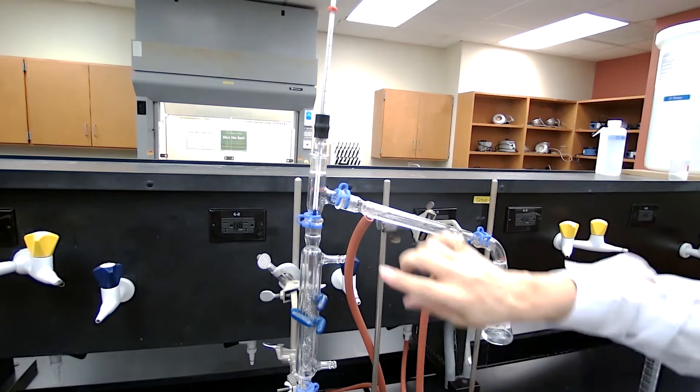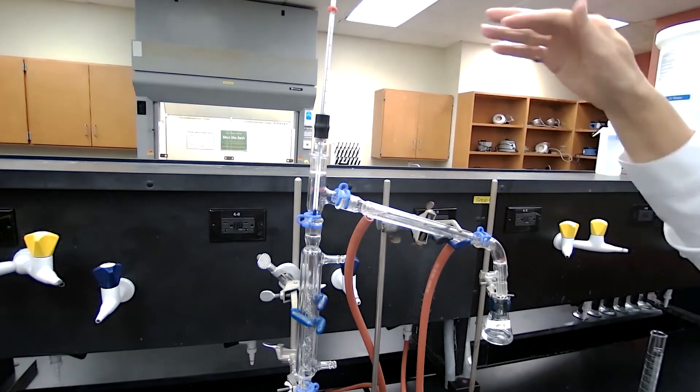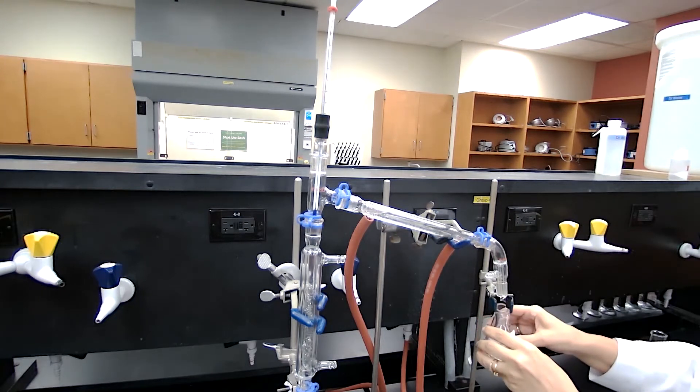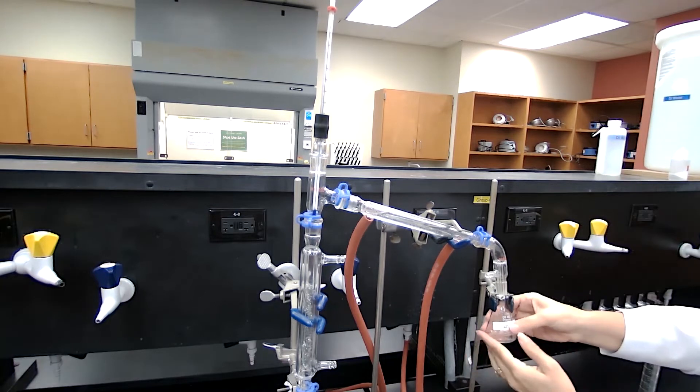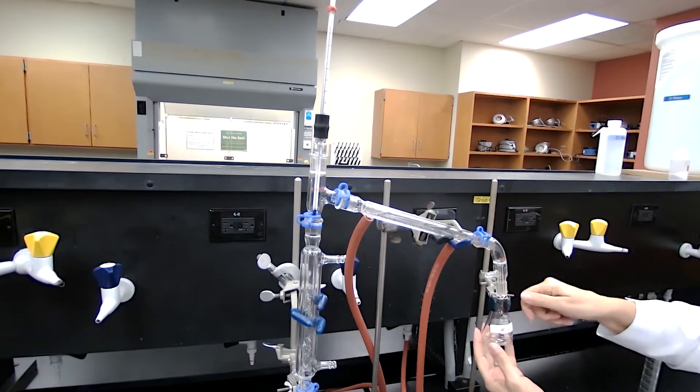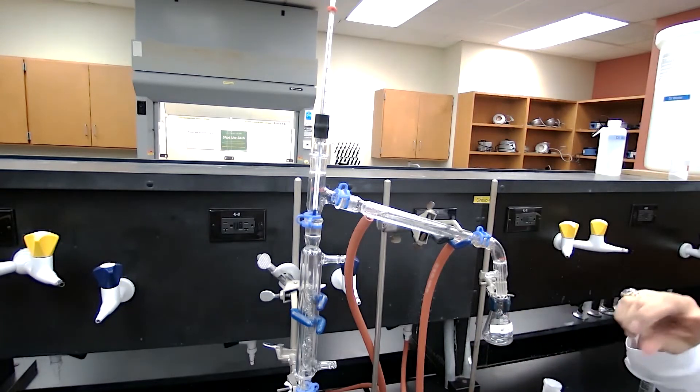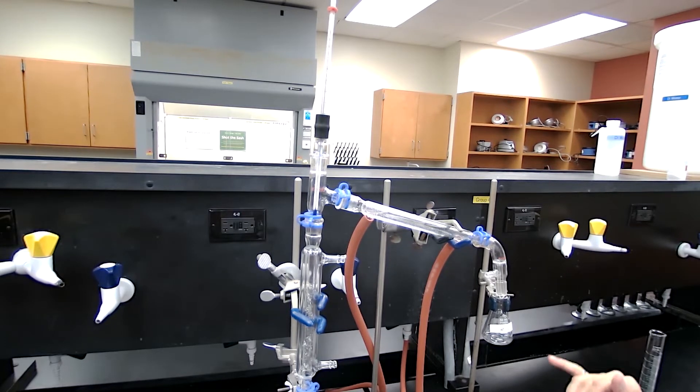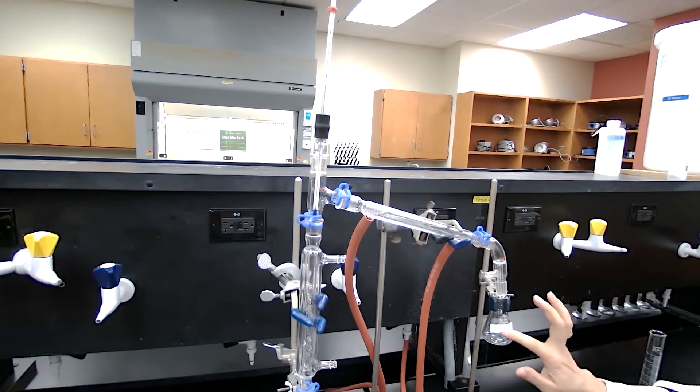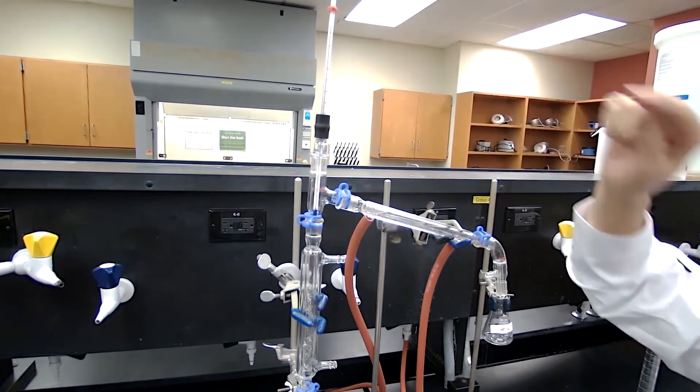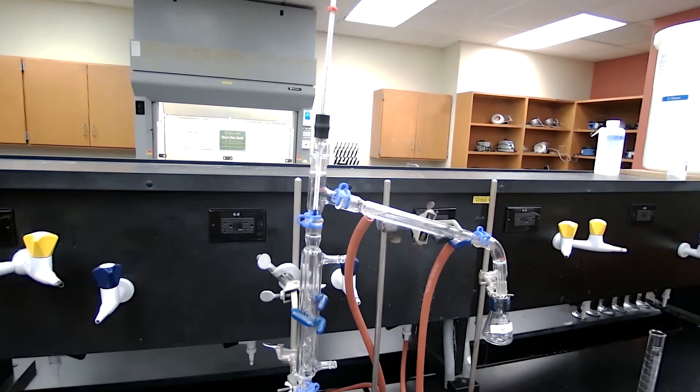Okay, the fractional distillation continued until, I waited until the temperature stays constant. Now it's been constant for a while and I'm switching the fraction three flask with fraction four. I want to make sure that the temperature stays constant. So what I'm receiving here is going to be a pure sample because I'm using fraction four and fraction two based on the procedure in the lab manual for my analysis, measuring the refractive index and measuring the properties of the sample. I want to make sure that I have a pure sample. And a pure sample is collected when, for the liquid, when the temperature stays constant. At least at that point, I'm sure that this sample is being collected is going to be pure.